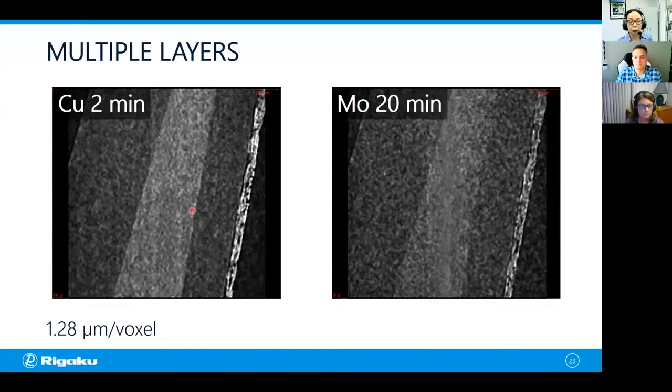The scan you have on the left, this is the one we just did, copper radiation 2-minute scan. The one on the right is the molybdenum scan, but we spent 20 minutes just to see some difference. And even after 20 minutes, you can barely see that the center UV resin part is higher density than the other two sheets. So you can, you know, right off the bat, see that the molybdenum is probably not a good choice for this sample.